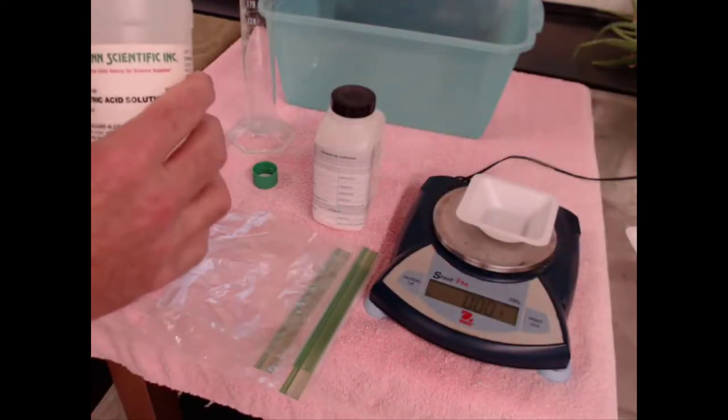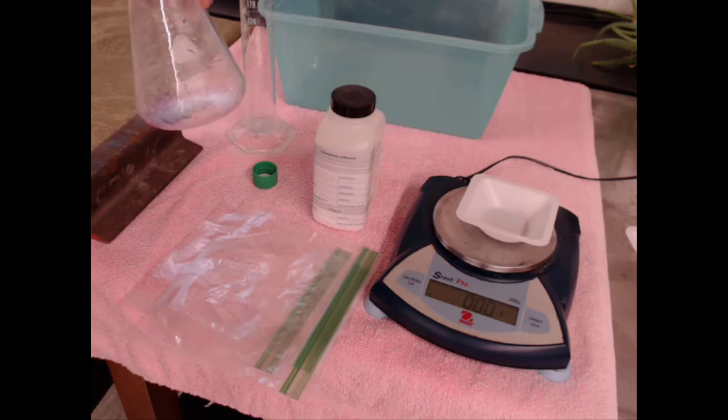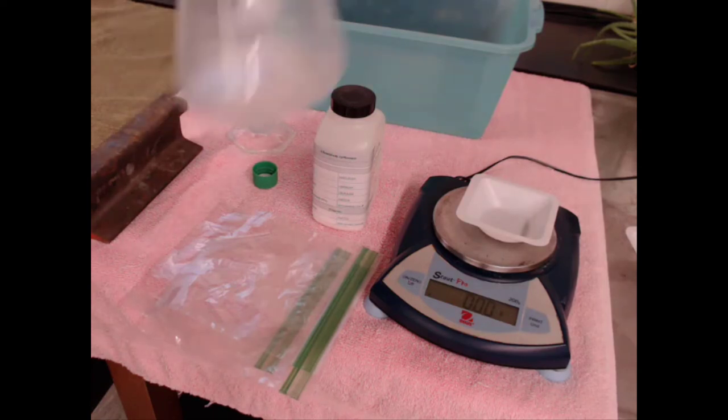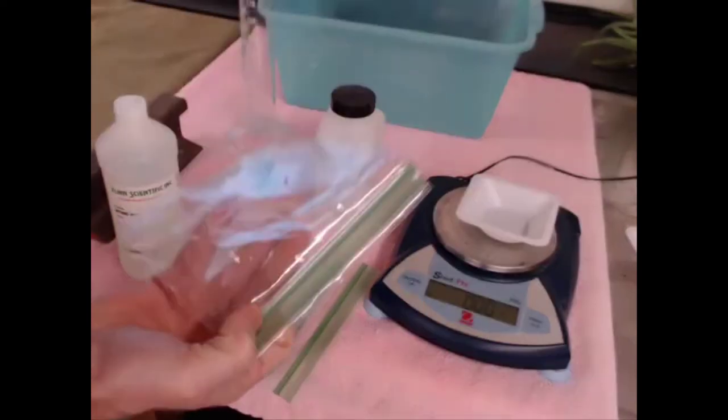I've got some of the aluminum carbonate in there, and I'll add some nitric acid. You can see the bubbles. I'm going to collect all that gas inside of a bag, and then we'll think through the stoichiometry.